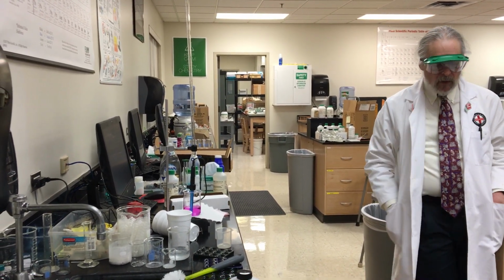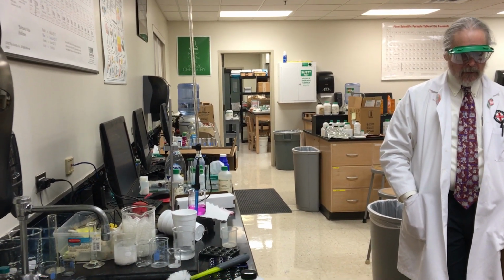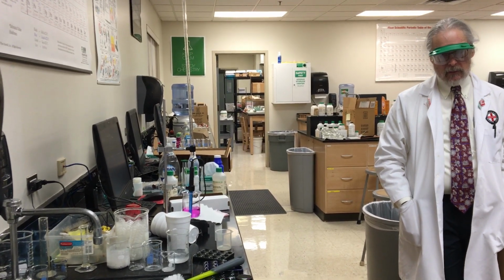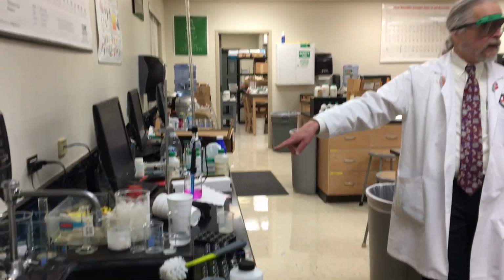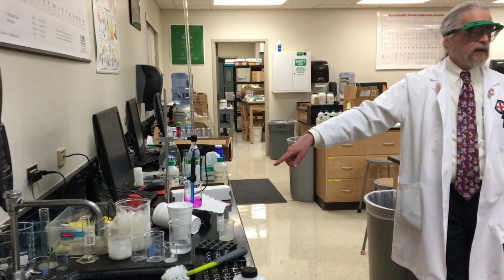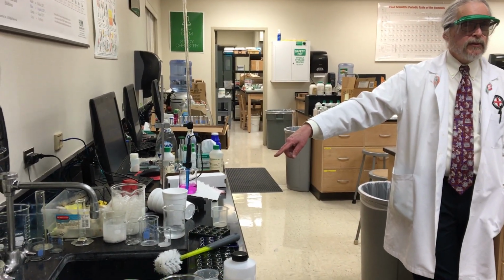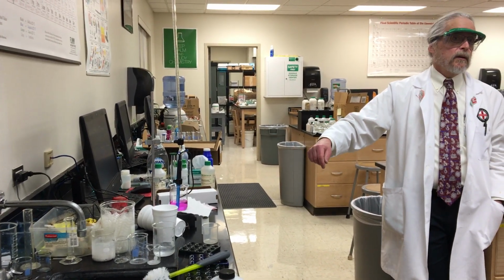Okay. What's the equivalence point? pH is 7. Moles of acid equal moles of base. What's the end point? Acid's all gone. Base. Your indicator changed color. Are those necessarily exactly the same point? No. But if you design the experiment properly, they ought to be really, really close.